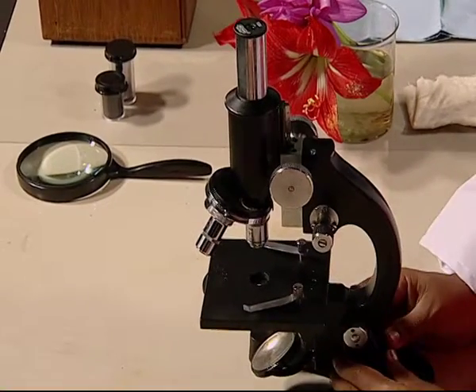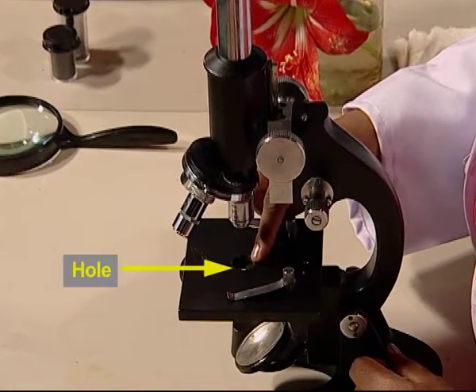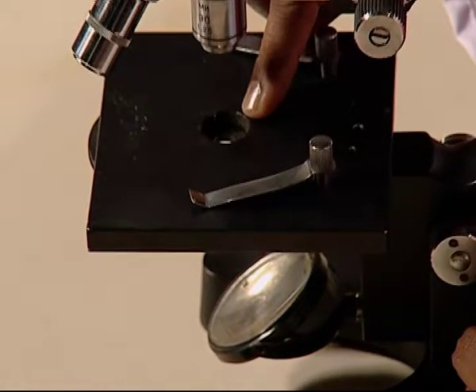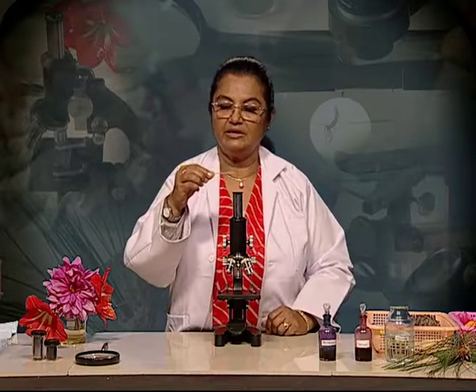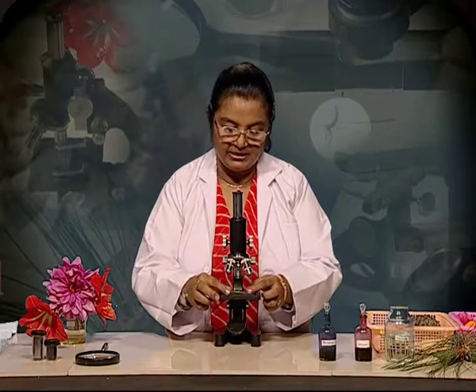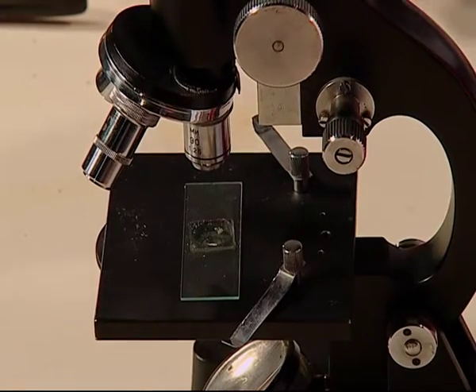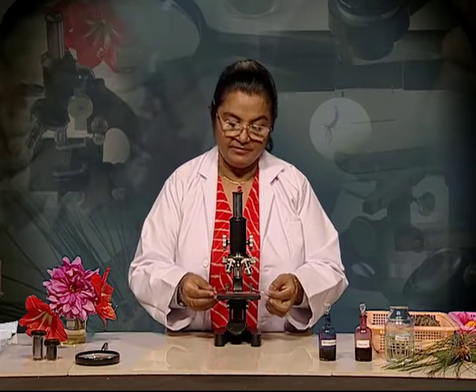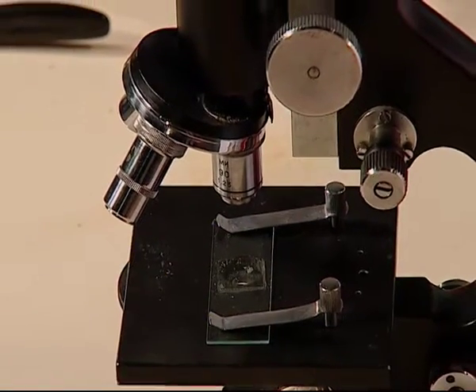As we saw in the dissection microscope, this stage has got a small hole in it. This is where precisely our object should be placed when we place a slide on the stage. So, I take this same slide of the pollen grains, and this is where I will position the object right over the hole on the stage. On the stage, there are these two clips to hold the slide into place.